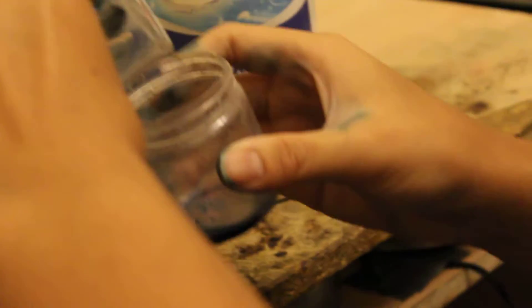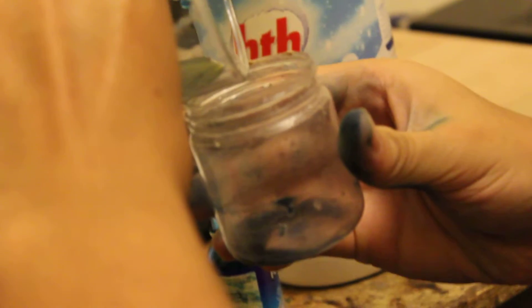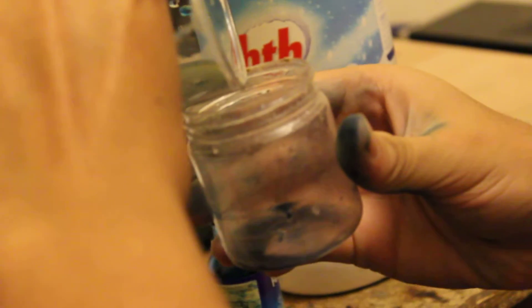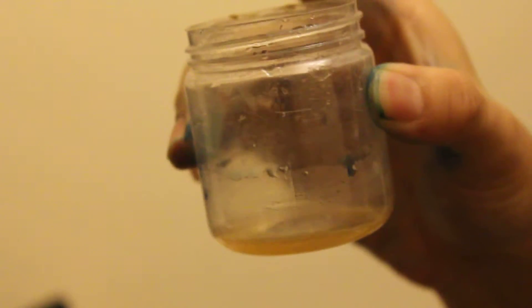A little bit of this solution dropped into this previous container, which only contained our chlorine granules, will cause a very dramatic change to occur. You can see it turns orange. It detects the presence of chlorine.